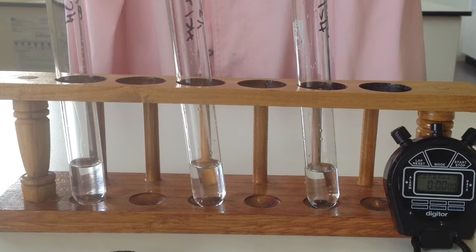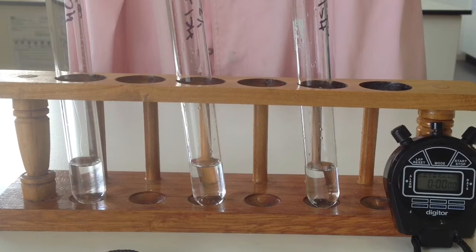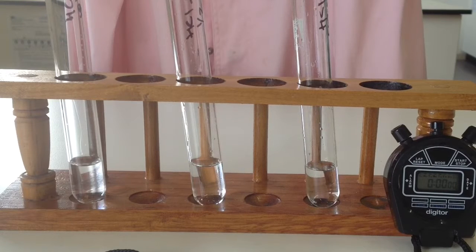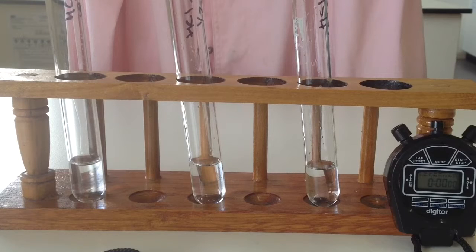Now, part of the observations, if you look at the worksheet I set up for you, you've got general observations, and then the other 2 we're going to look at are time, how long the reaction went for, and also the height of the bubbles, if we get a fair bit of fizzing and there's a bit of height in those bubbles. Alrighty, so the first one we're going to look at is surface area.